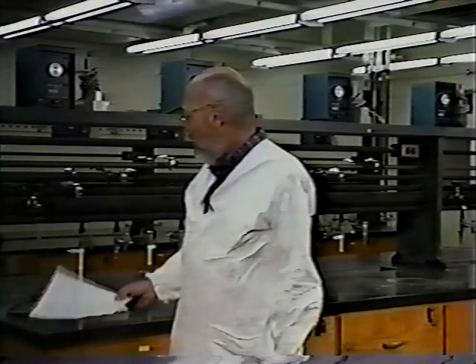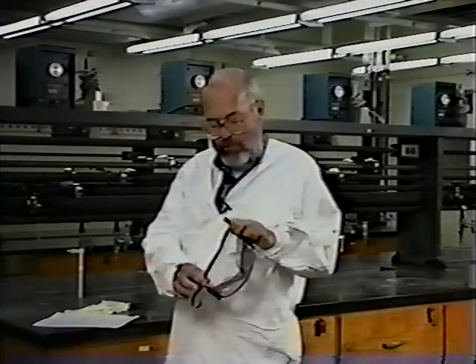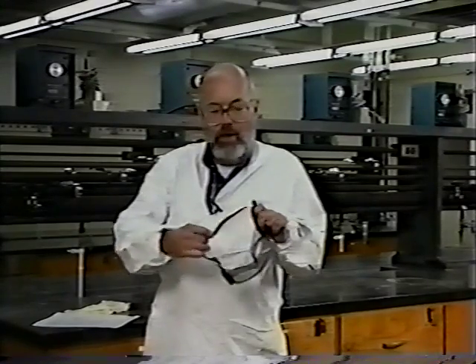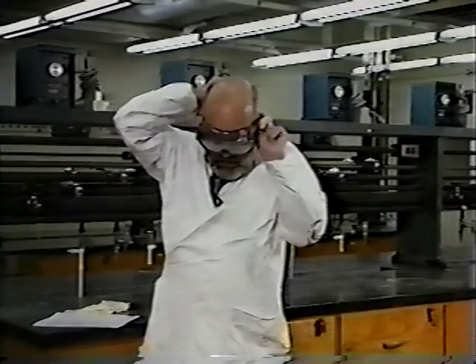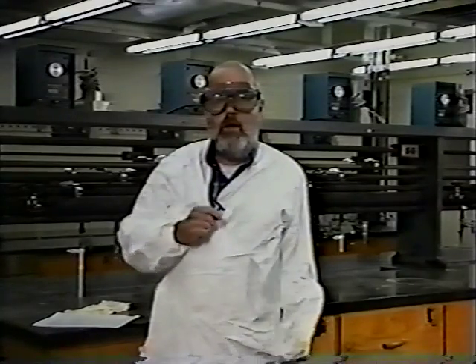Among the important precautions that we take to avoid injury is the use of protective clothing and equipment. Probably the most important part of your body to be protected is your eyes. And for that purpose we require the wearing of goggles at all times in the laboratory when anyone is doing any experimental work at all.